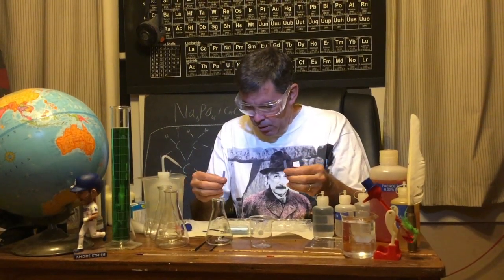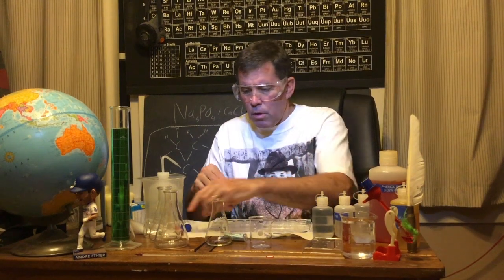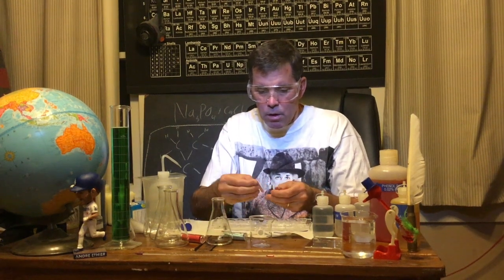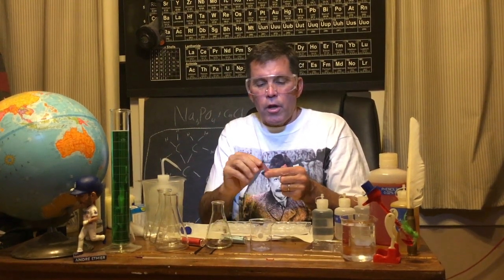So what I'm going to do is I'm going to lay out pieces of paper. I'll hold them up so you can see them. And I'm going to test them with the different solutions. So this paper here is red, as you can see, and this one's blue. It's the same basic dye, but there's two color versions of it. And you're going to collect the data, make some observations, and you're going to see how different acids or bases affect it.